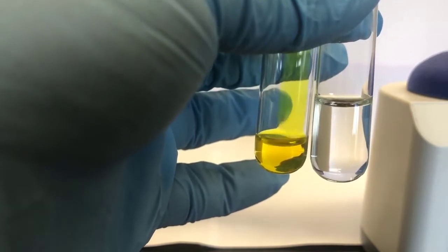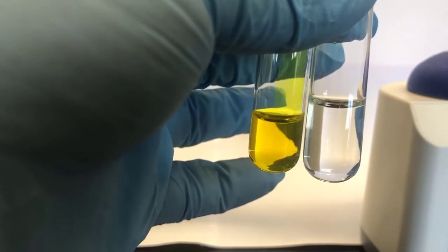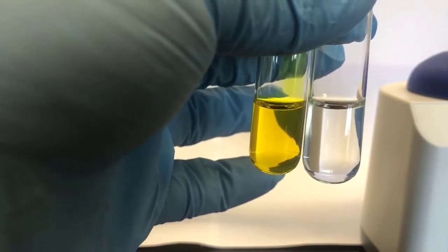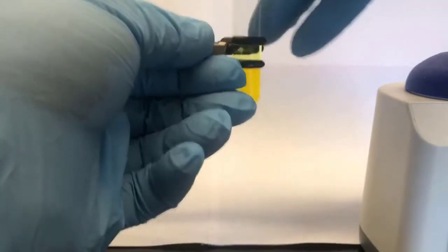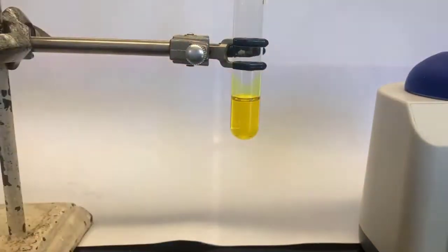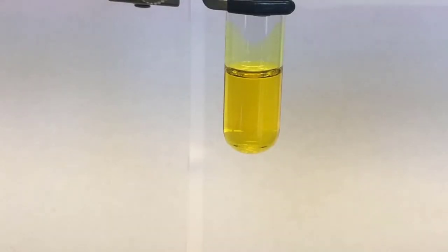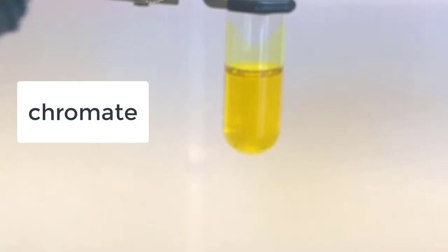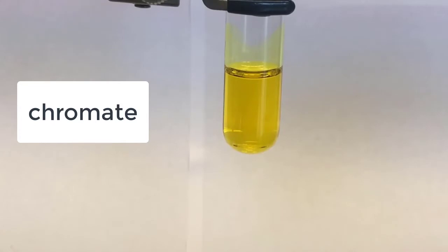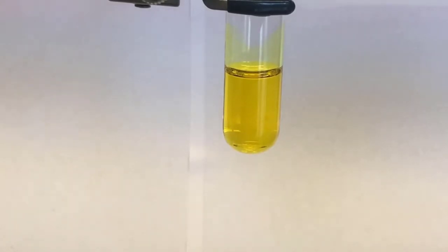Again, that's 3 mL on the right, and when I get about that volume, I'll stop. There, and that's 3 mL on the left. So now we're ready to start our experiment. And I'll add 2 to 3 drops of concentrated hydrochloric acid. I'll shoot for 2, but occasionally it doesn't quite work out how you want, so refocus that. I'll add the 1 so you could see before any mixing takes place.